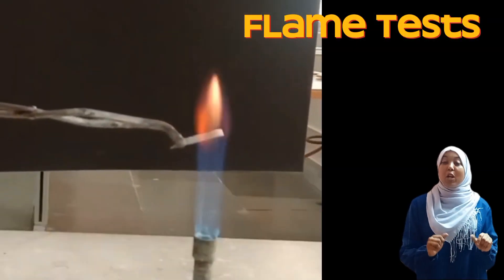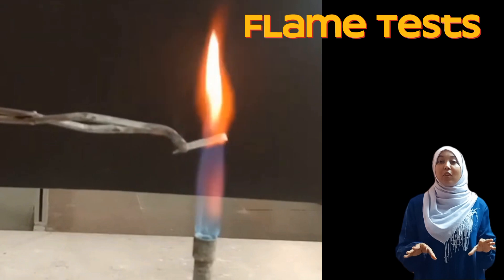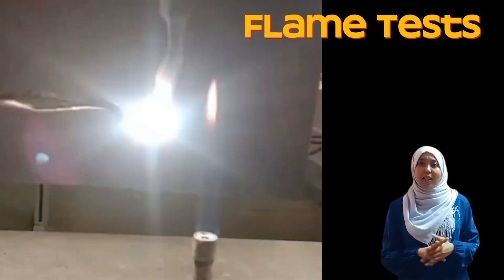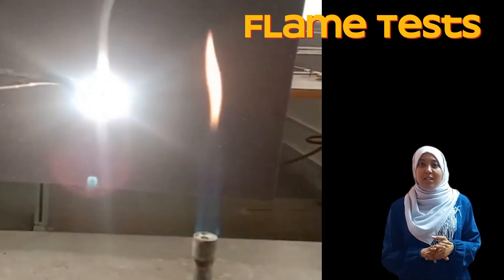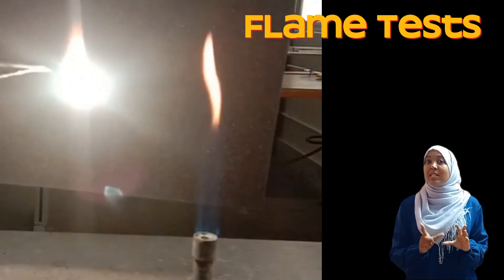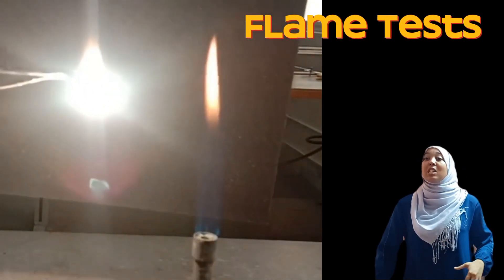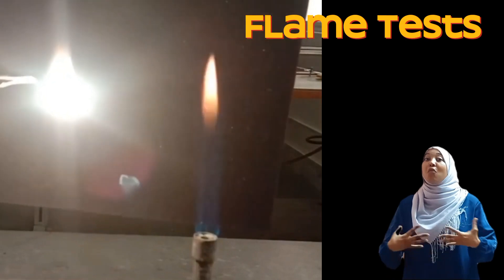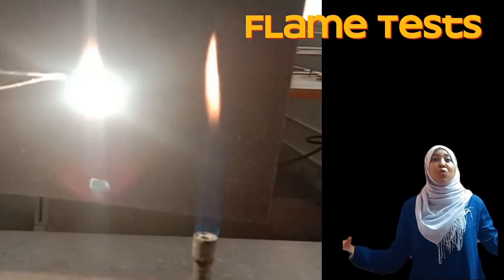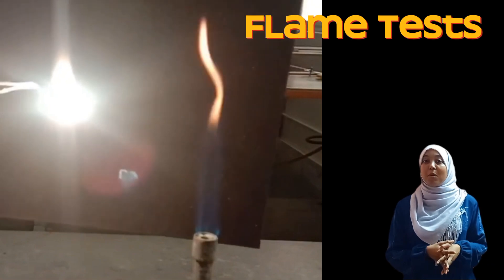Next, magnesium. Magnesium burns with a blindingly white flame — it's so bright. As you can see from the flame colors, a lot of these metals are used in the production of fireworks, and that is the reason why we have those beautiful colors in the sky as a result of these compounds.